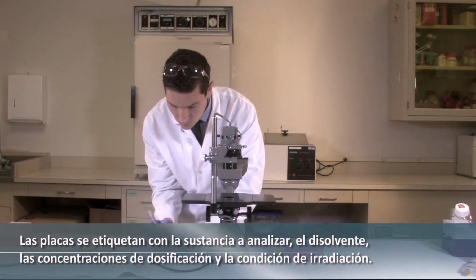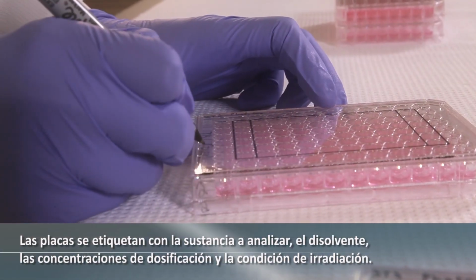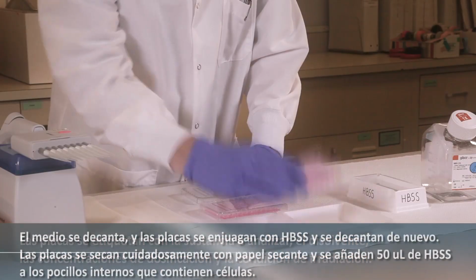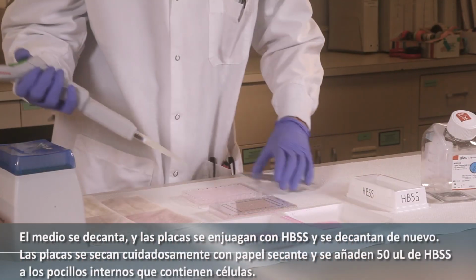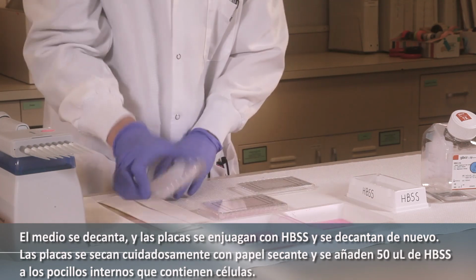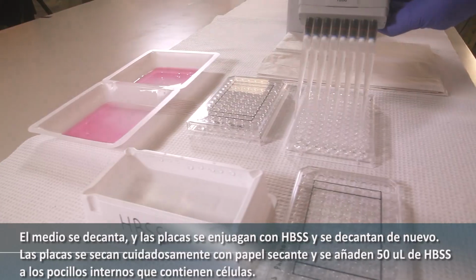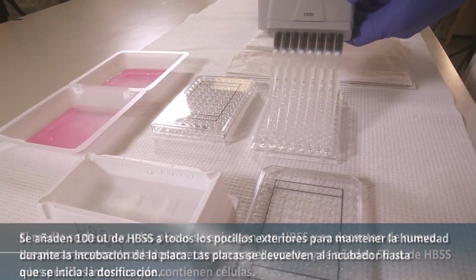The plates are labeled with the test substance, solvent, dosing concentrations, and irradiation condition. The medium is decanted, and the plates are rinsed with HBSS and decanted again. The plates are carefully blotted dry, and 50 microliters of HBSS are added to the inner wells containing cells.